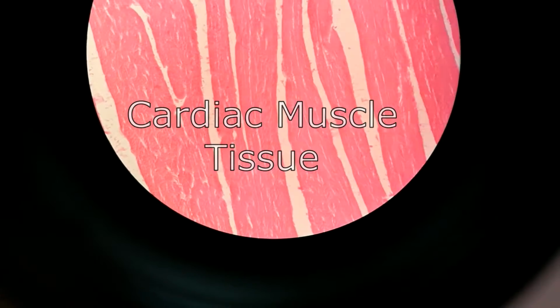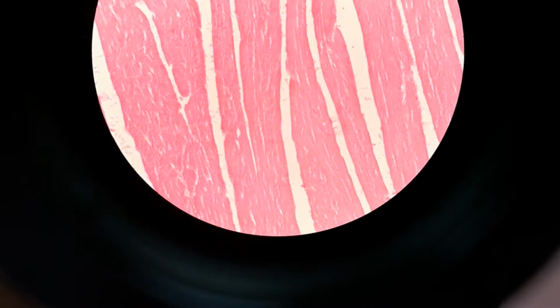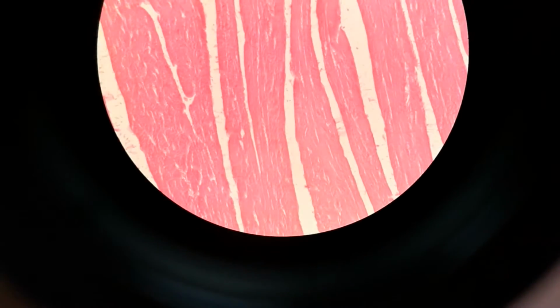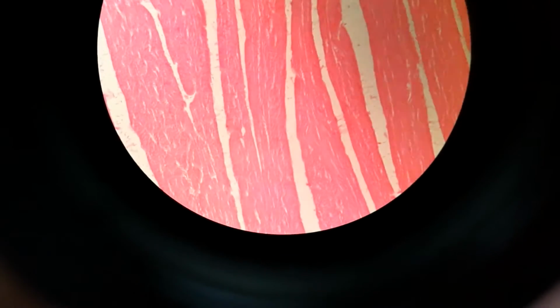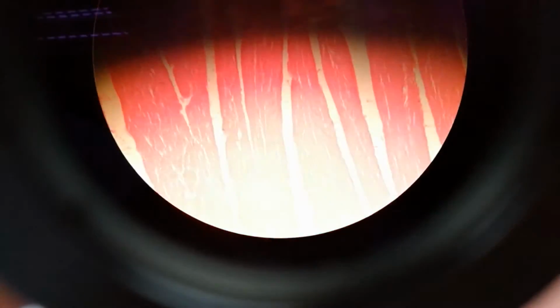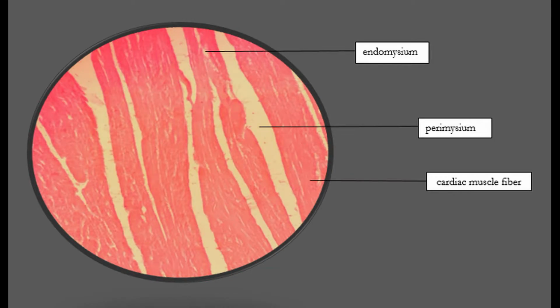Okay, the next tissue is cardiac muscle tissue. Cardiac muscle fibers are striated, branched, sometimes described as Y-shaped, and have a single central nucleus. These fibers are attached at their ends to adjoining fibers by thick plasma membranes called intercalated discs. Okay, basically the function of this tissue is the pumping of blood through the heart. This type of muscle tissue can only be found in the walls of the heart.